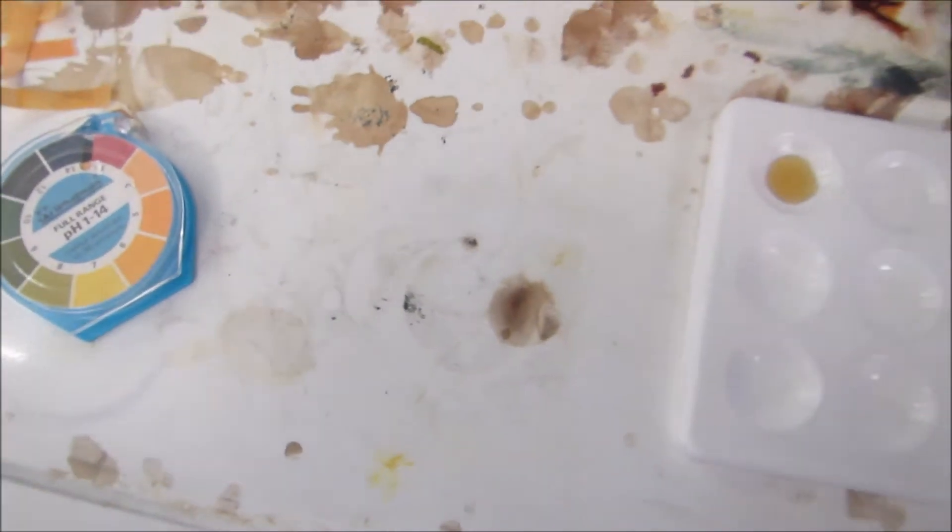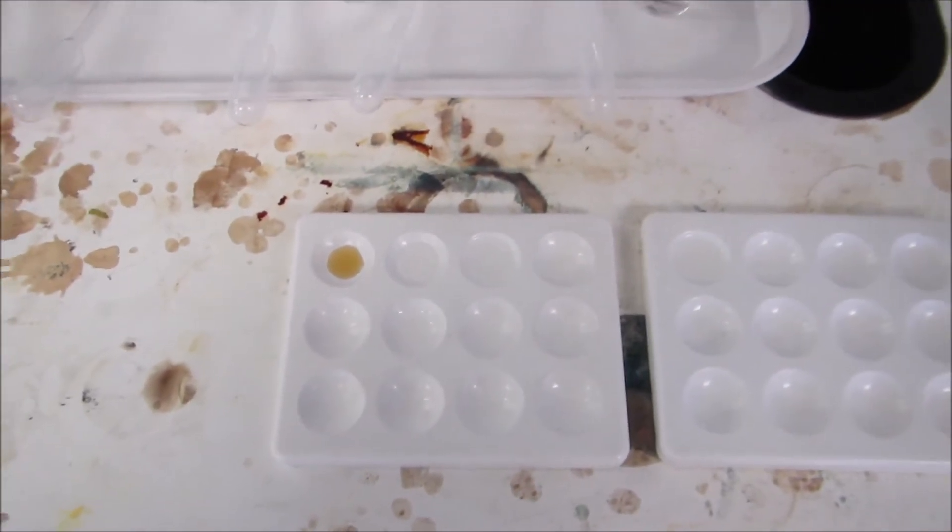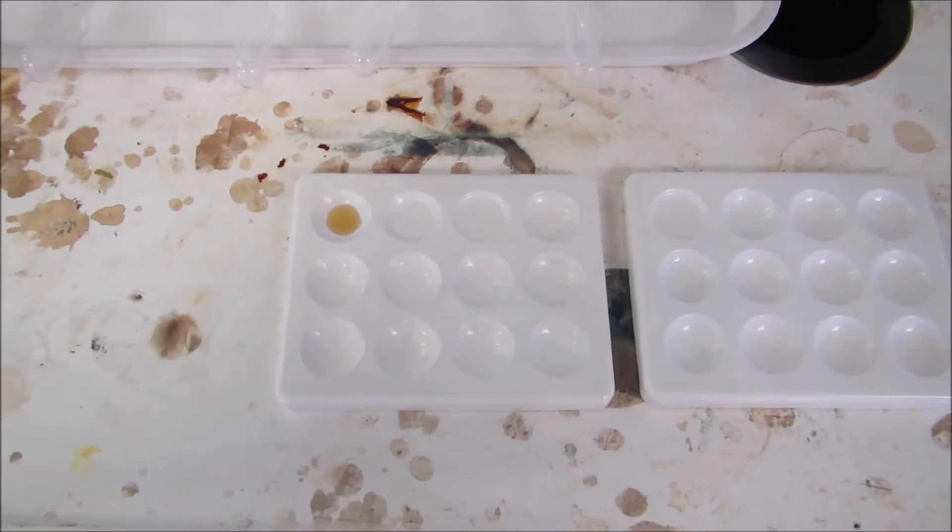So from this, you should be able to work out the pH of the five solutions and see if that could be used to identify any of the groups.